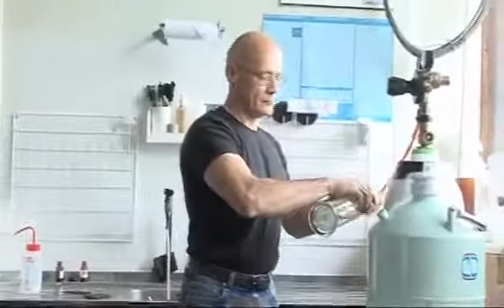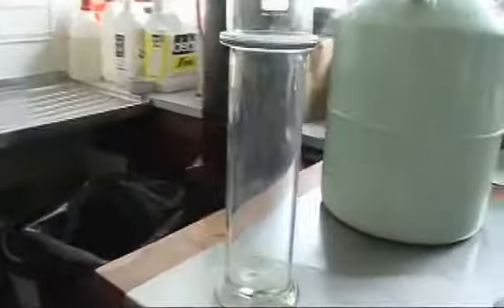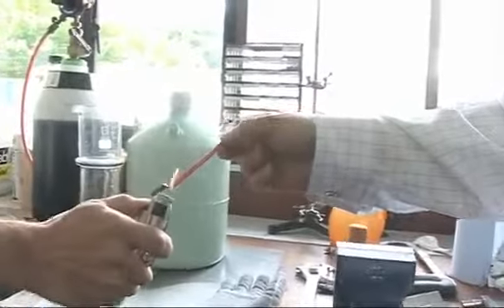So Neil's now connecting up a piece of tube to the oxygen cylinder, and he's going to fill up this gas jar with oxygen. And we're going to do a really classic experiment, the one that everyone learns at school, a test for oxygen, which is to relight a glowing splint. So we have a traditional gas jar full of oxygen. So here you can see we're burning a splint. Okay, so this is the wood burning in excess oxygen around us.